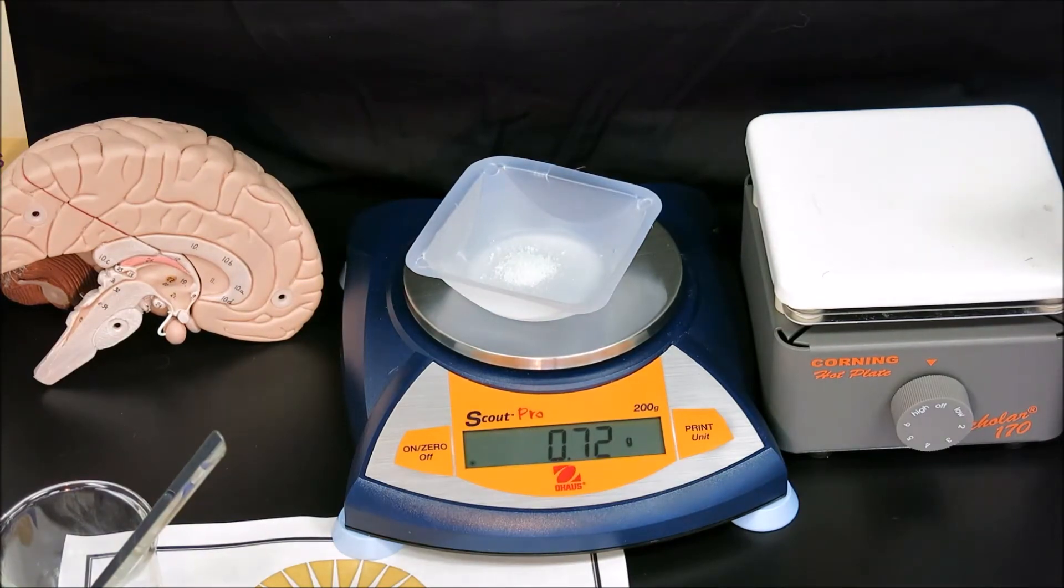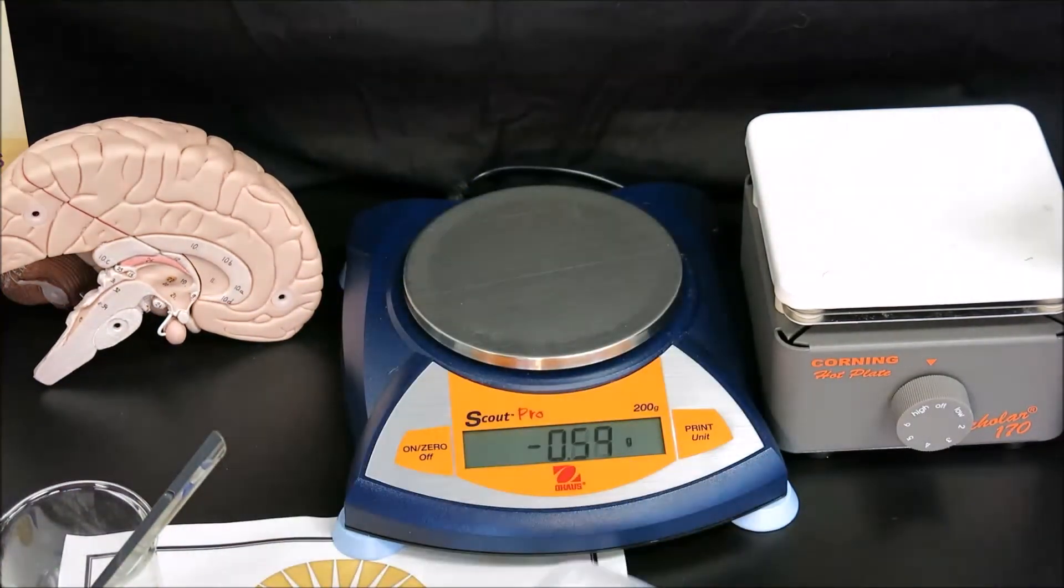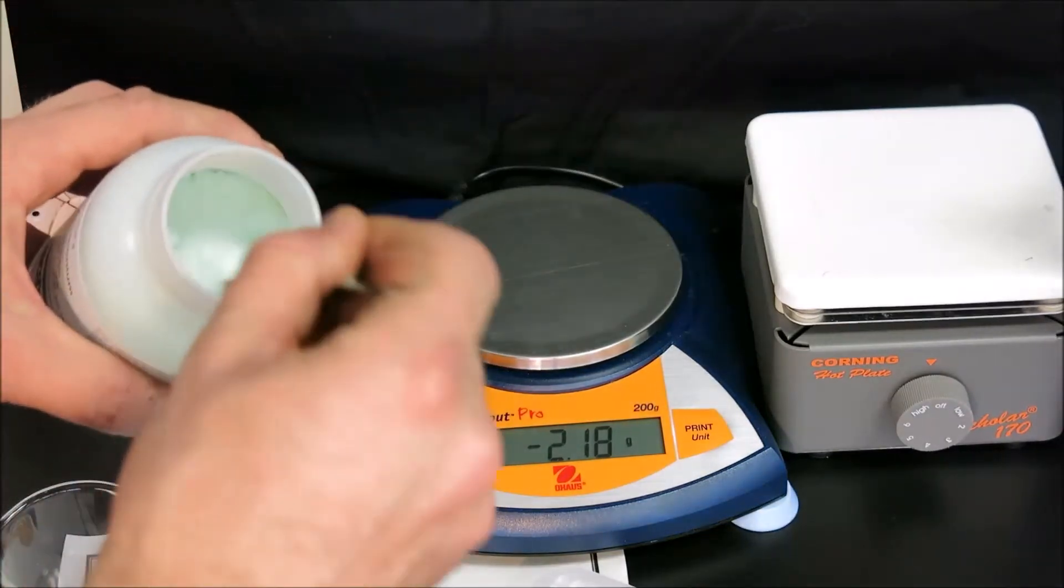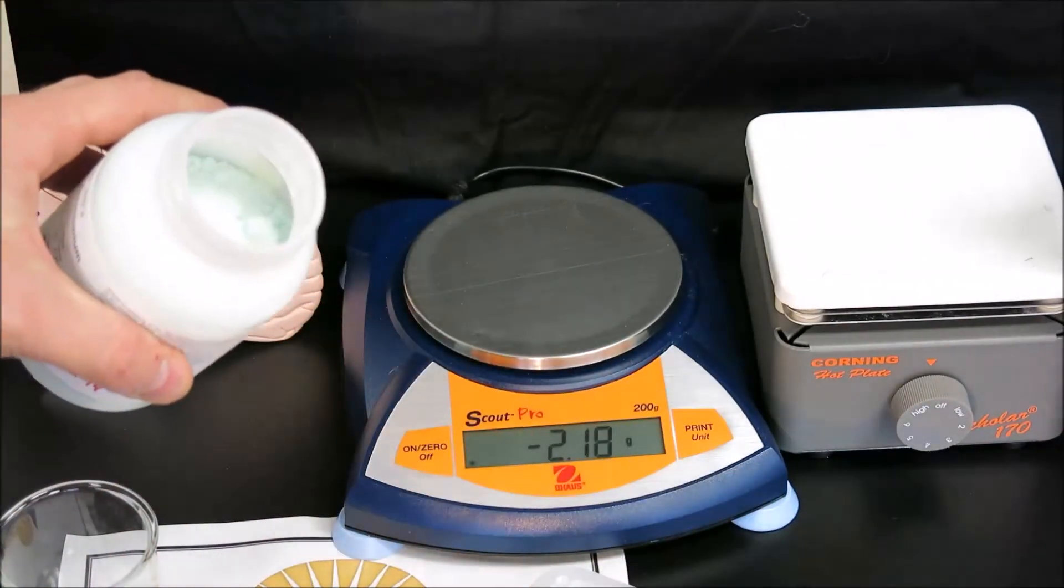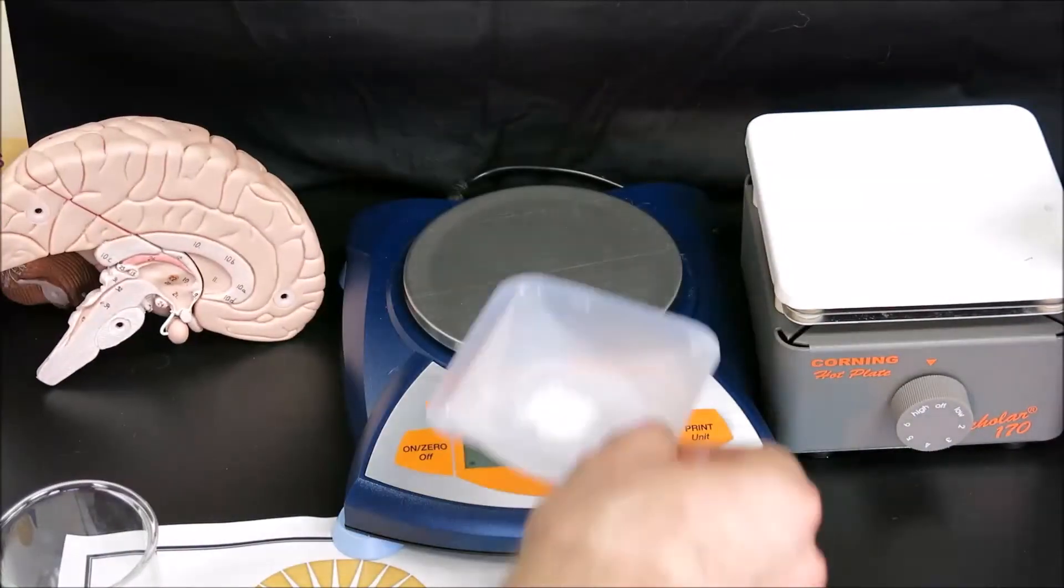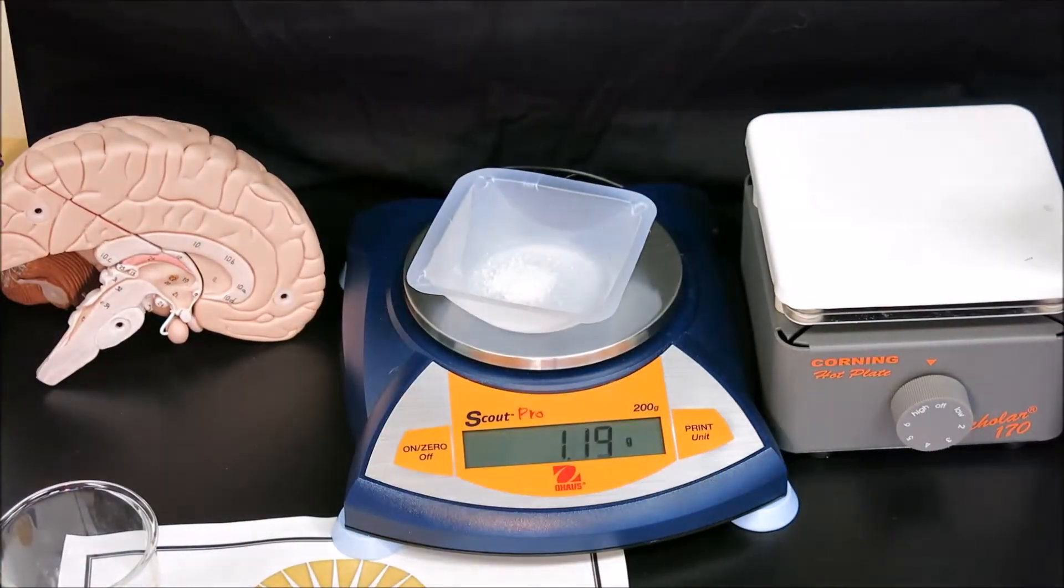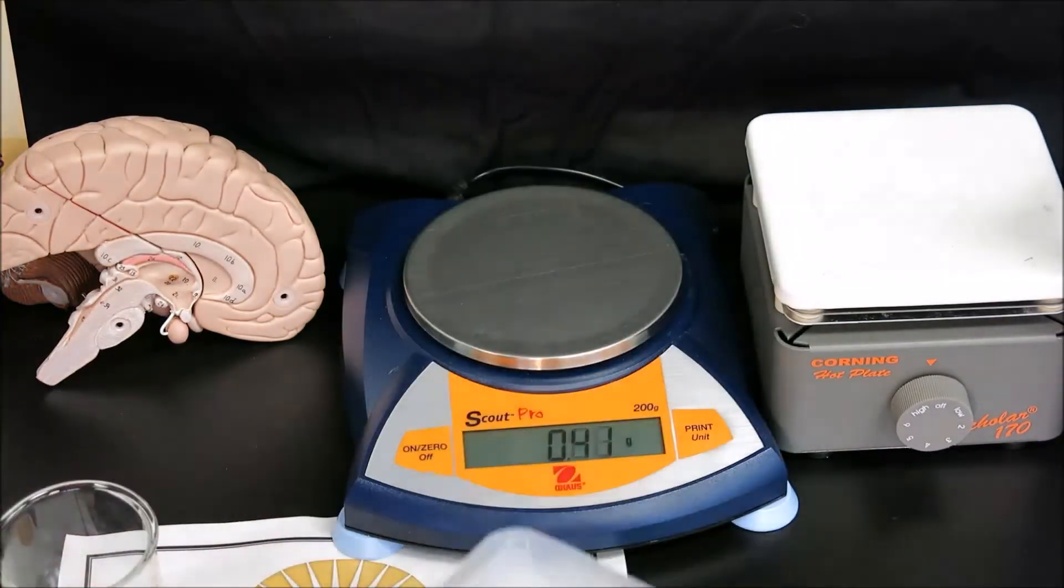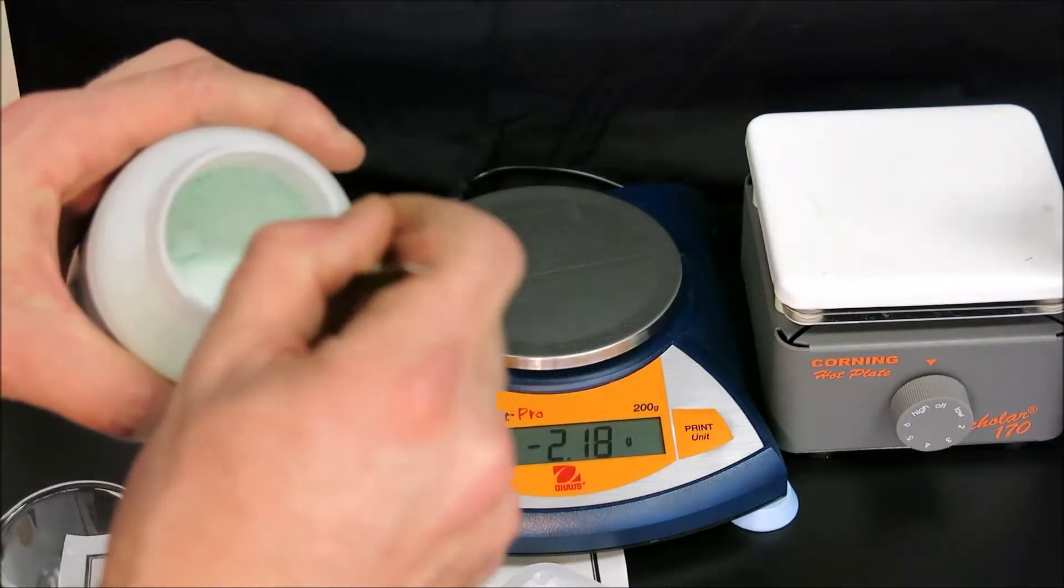In this case, we're under mass, so we need to repeat the procedure to get closer to 1.00. Very close now, we're going to add only a tiny bit, hoping to not have any excess.